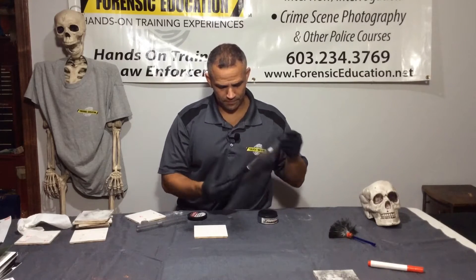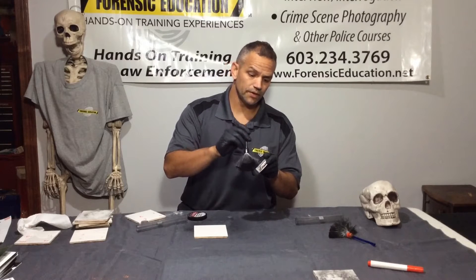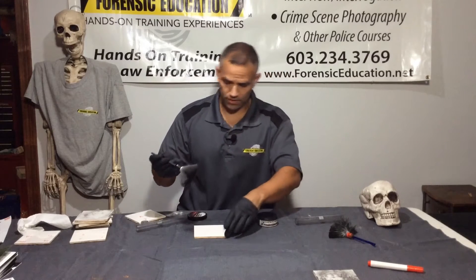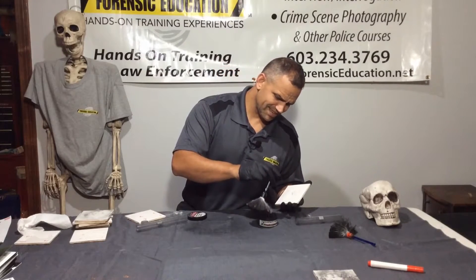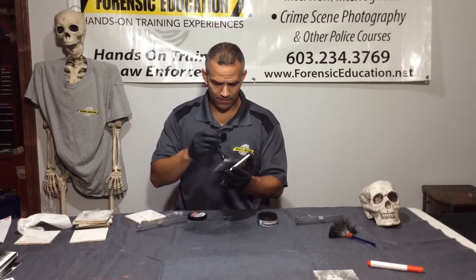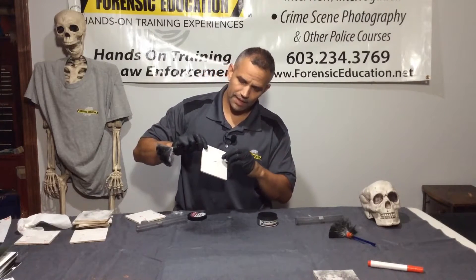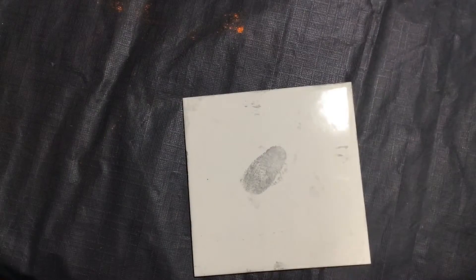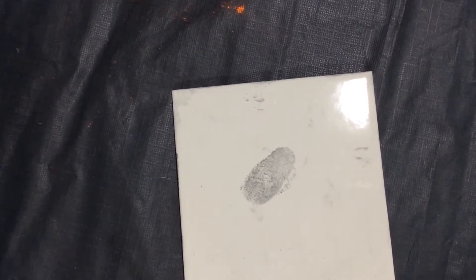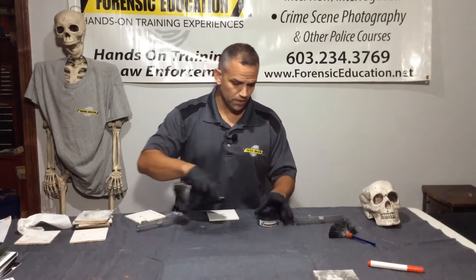Now I'm going to use my new brush. I only have a little bit of powder in here because that's all we need. I'm just going to take a tiny little bit of powder and dust it on there. That is looking good — a smidge more — and just develop it even better. I have a very nice fingerprint here. Here is my fat juicy print — look at that — all of that detail looking fine.